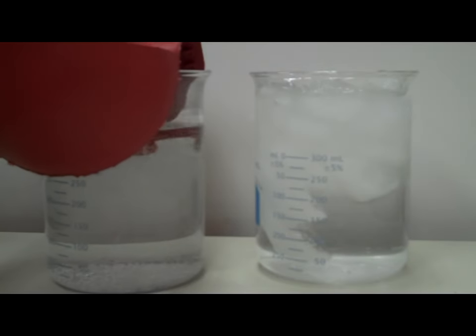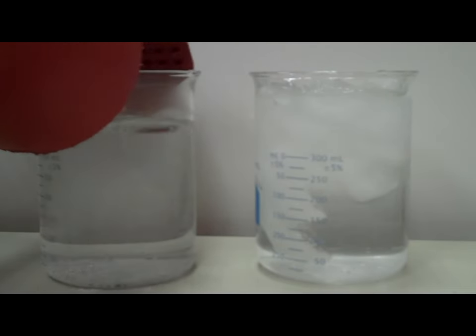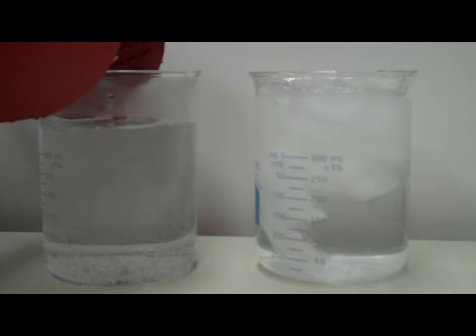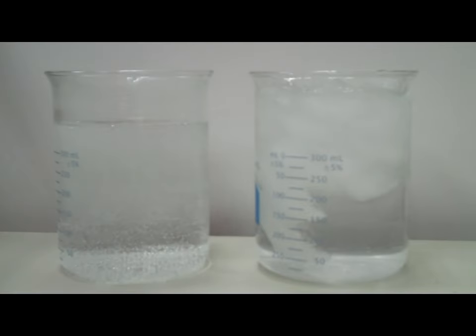So on the left of your screen, I'm putting my beaker that has the hot water in it. And on the right is my ice water.